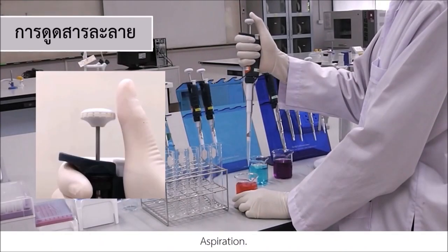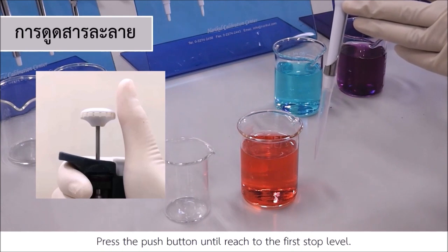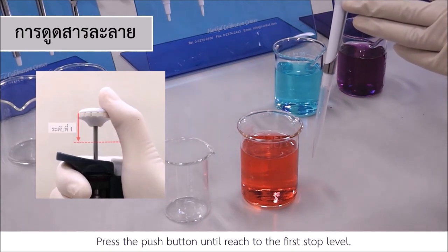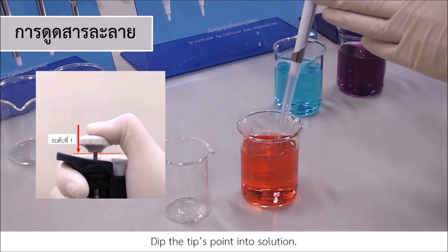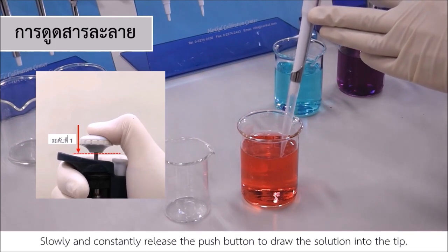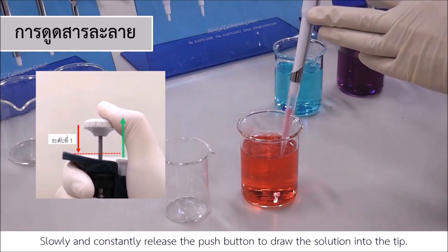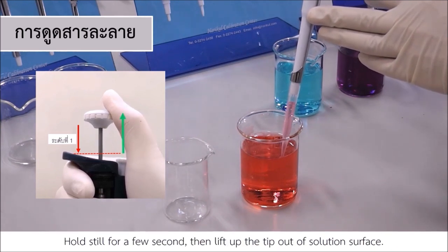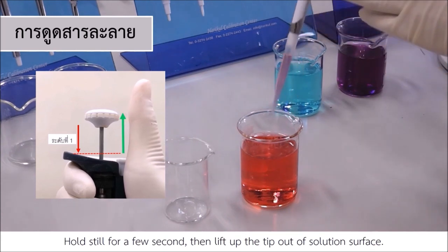Aspiration. After volume adjustment and fitting the tip, hold the autopipette vertically. Press the push button until reach the first stop level. Dip the tip point into the solution. Slowly and constantly release the push button to draw the solution into the tip. Hold still for a few seconds, then lift up the tip out of the solution surface.